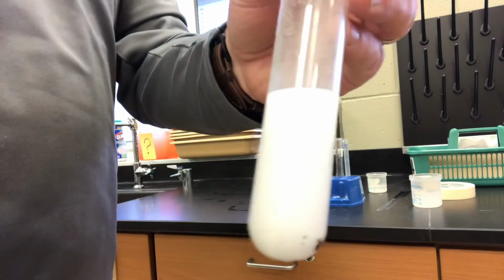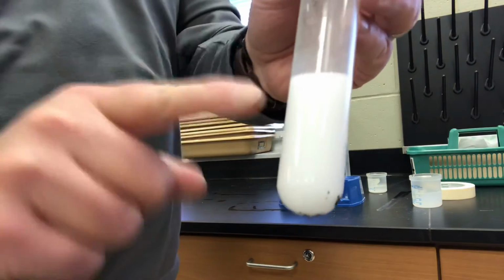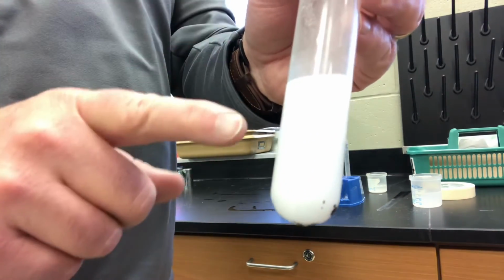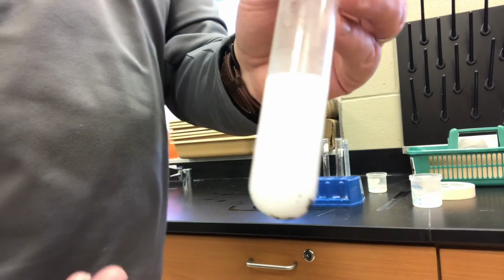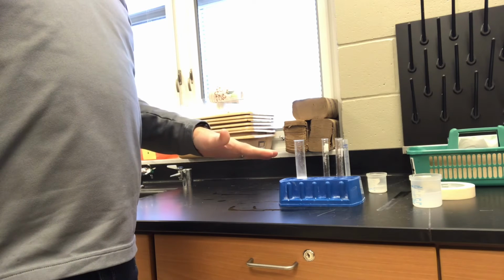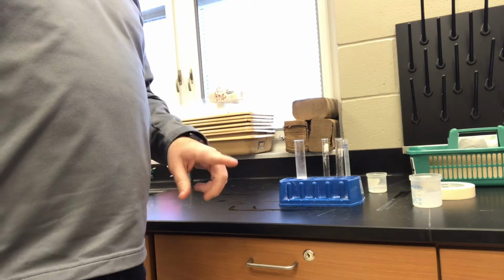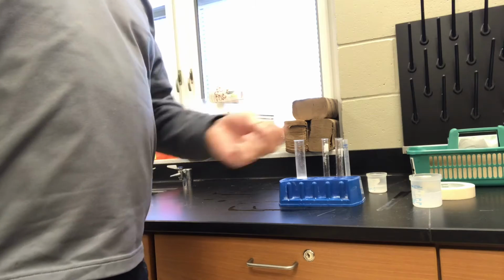So we've got evidence of chemical change, evidence of a chemical reaction that is occurring, but this is not the precipitate. I want to make sure that we really hammer this home. This is not precipitate. Yes, we have gas given off. We have bubbles. Those are examples of chemical change and a chemical reaction. But we're going to put that test tube back in the test tube rack and let it sit and chill for a little bit. Then we're going to come back, and we will see the evidence that I'm talking about, this solid that forms out of solution. So we'll be right back.